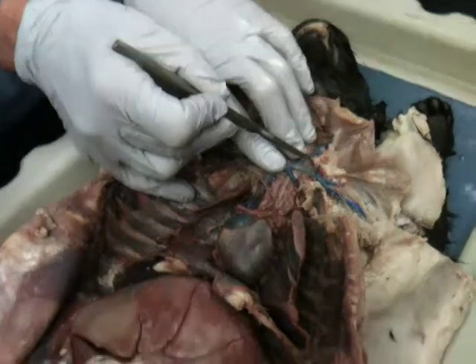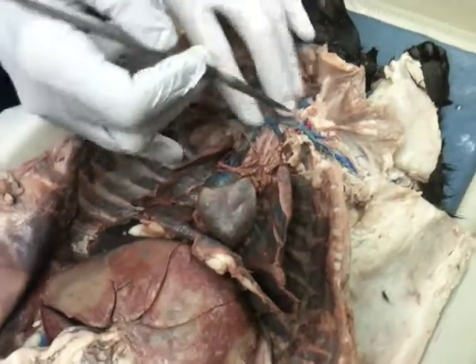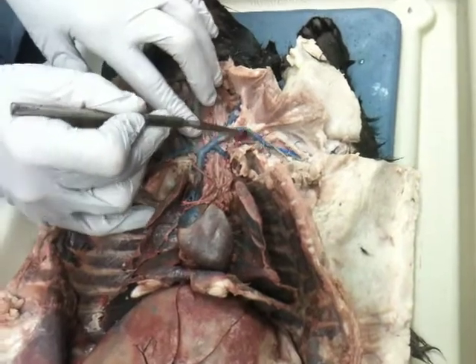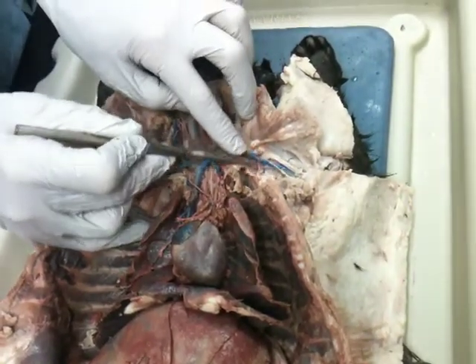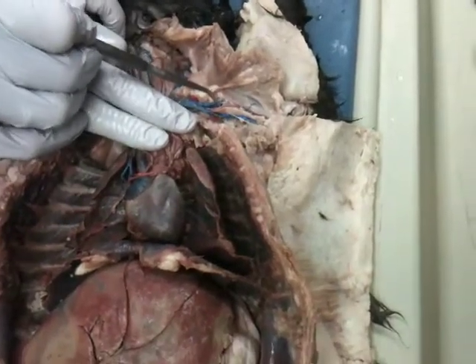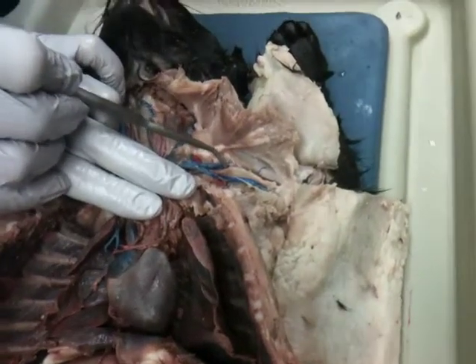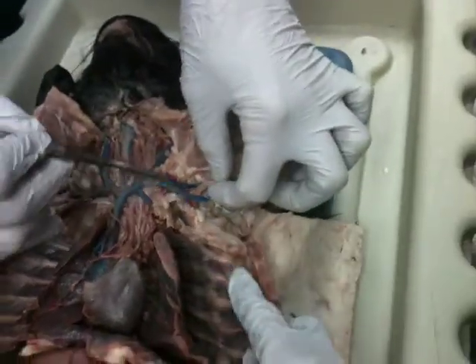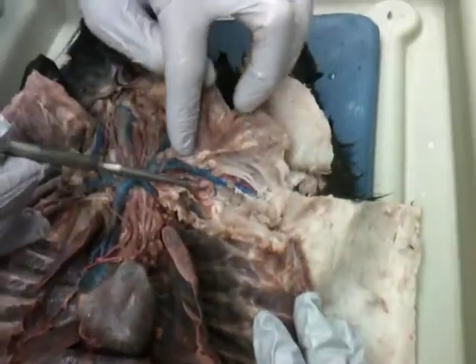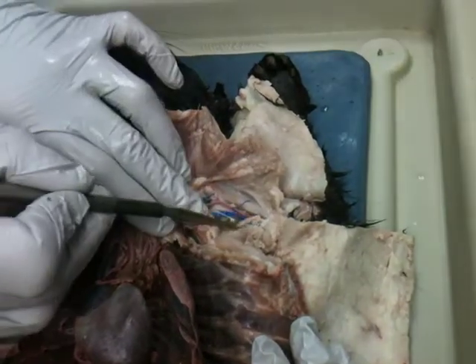Once it curves around that first rib, it'll become the axillary, going around the axillary area, your armpit area. This one has been broken off over here. That's a continuation from there to there. So axillary will continue here. We'll send a deep branch down here, that one, that goes to the subscapular, going down to the scapula. Once that has branched off, and once the long thoracic, this little guy, has branched off, it's now the brachial.